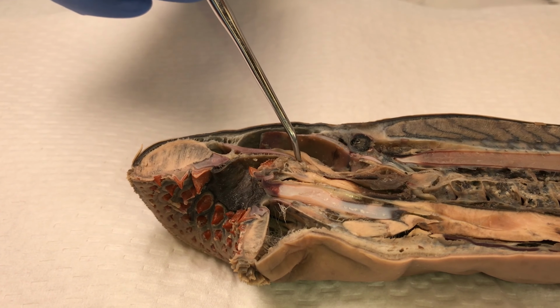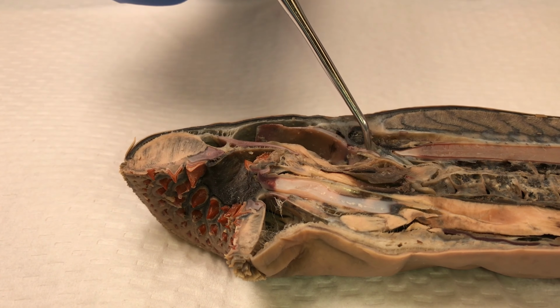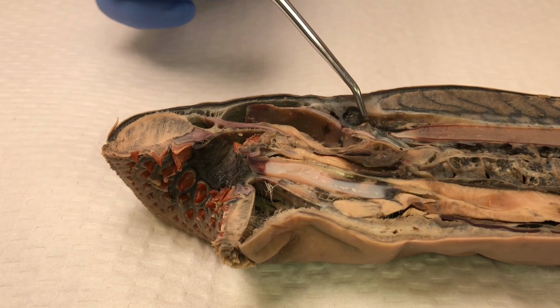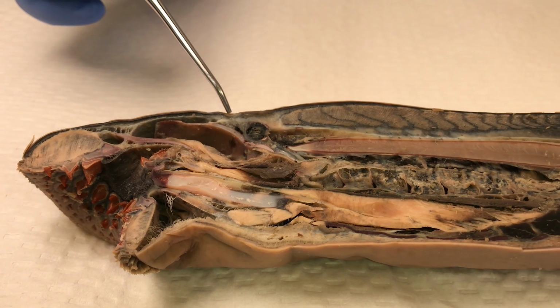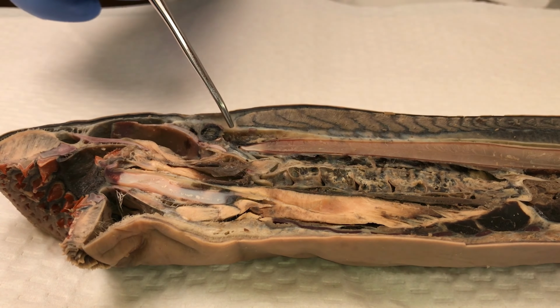So we have those keratinized teeth, the annular muscle, annular cartilage, more annular cartilage below, the annular muscle again. Here's the lingual cartilage, and then those keratinized teeth on the tongue. We have the anterior dorsal cartilage and the posterior dorsal cartilage. There's the olfactory sac, which connects to the nares, and the pineal organ on the surface and below.